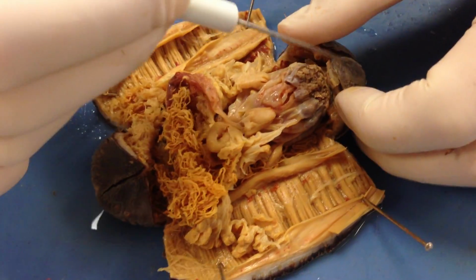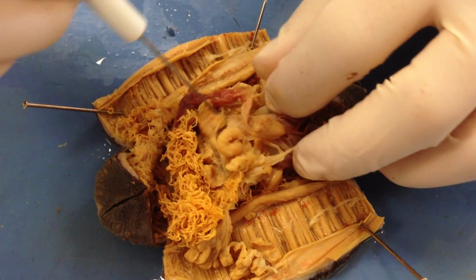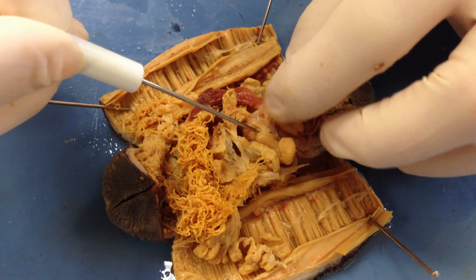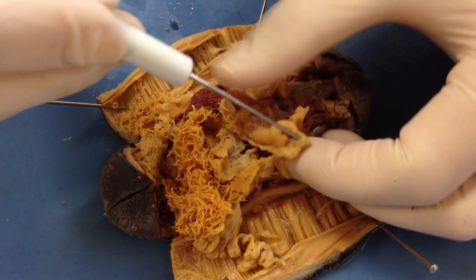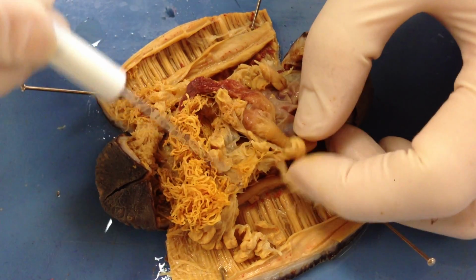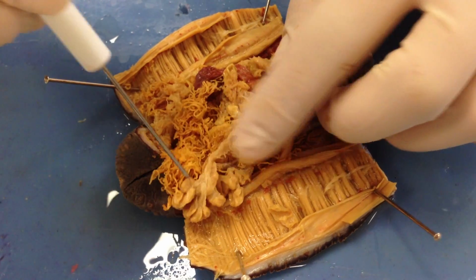Coming back to the main area, if we were to run down the pharynx, we're going to run into, of course, the first part where it's exiting out, and this is going to be the esophagus. The esophagus turns into the stomach, which is this next section here, which then leads into the intestines, and you can find intestines later on down here in this area. You can see what those look like.